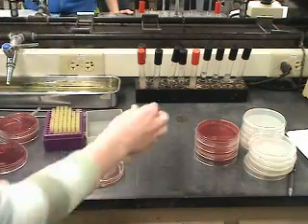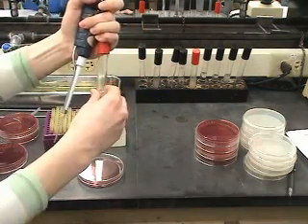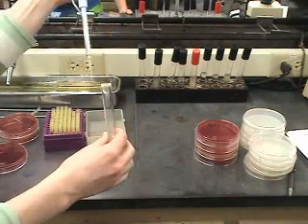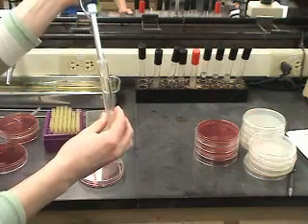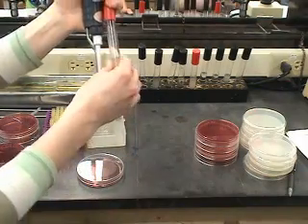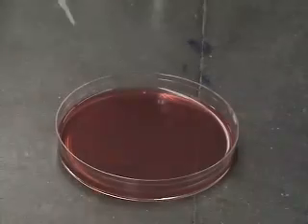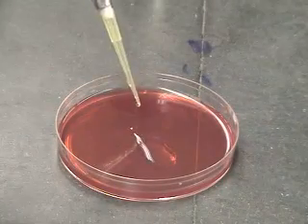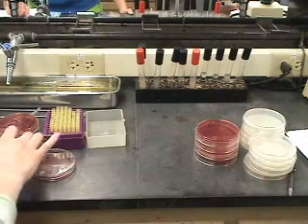Once all dilutions are complete, portions of target samples are dispensed onto appropriate media. The dilutions actually used for plating are dependent upon the estimated population of microbes, and knowing how much to dilute a sample is a matter of experience. Volumes of 100 to 500 microliters are normally put on a plate, with 100 microliters being the most common volume.